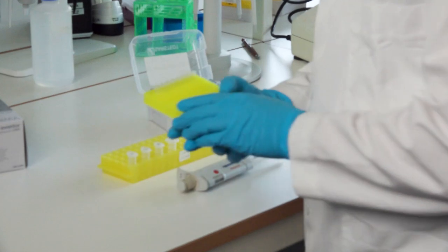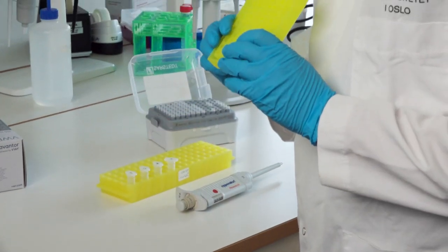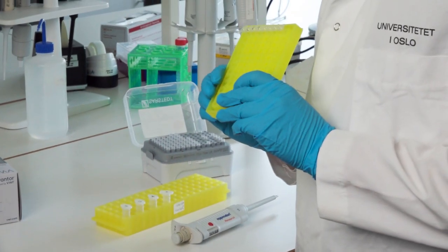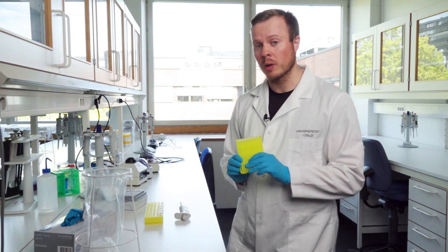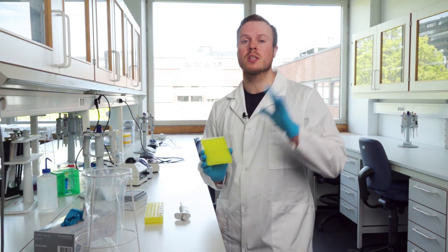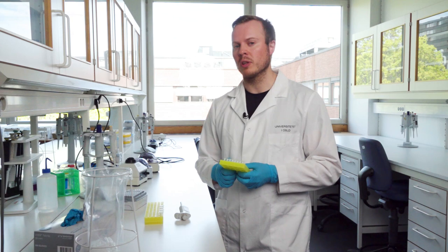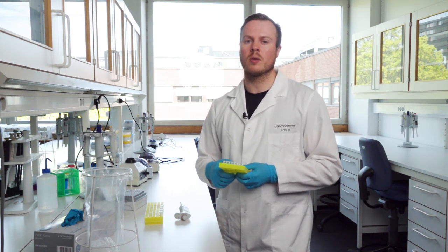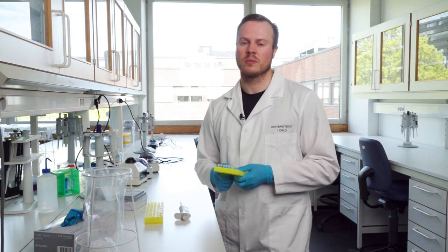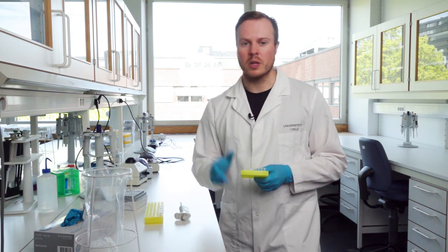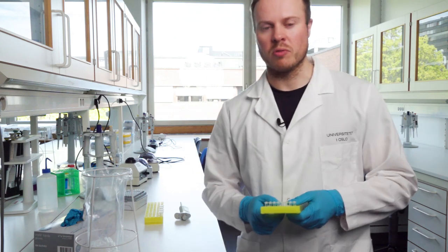So now it's all ready to run the PCR-2. The PCR-2 is a different program than PCR-1. It's still in the same room, still the same machine, but it's normally a little bit different in annealing temperature, and it's also a different amount of cycles, normally less cycles. So then we go into that room, and I will explain a little bit further.